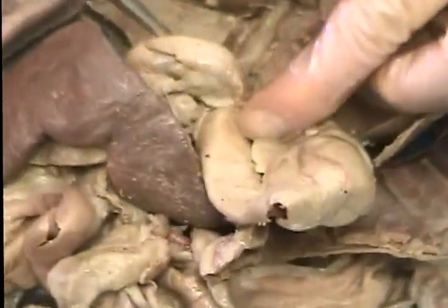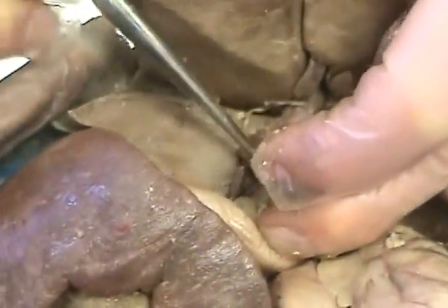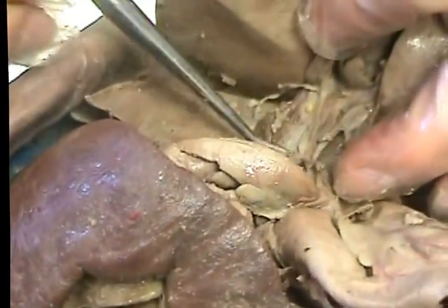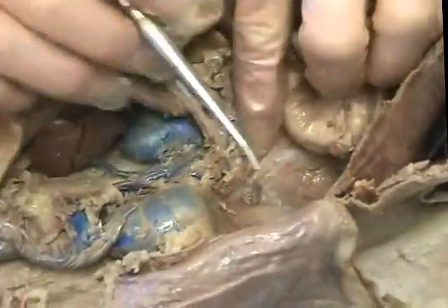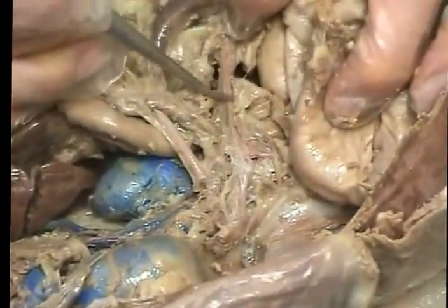Between the liver and the diaphragm is the phrenic vein, right there, that blue one. Going from the liver to the intestines is right here, hepatic portal. It's kind of blue. First pink one coming across is the celiac. There should be 3 branches of the celiac.